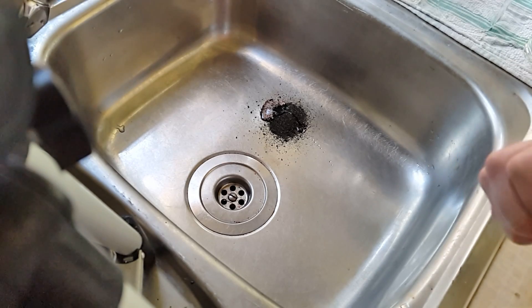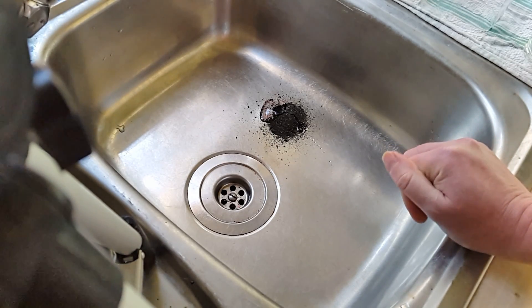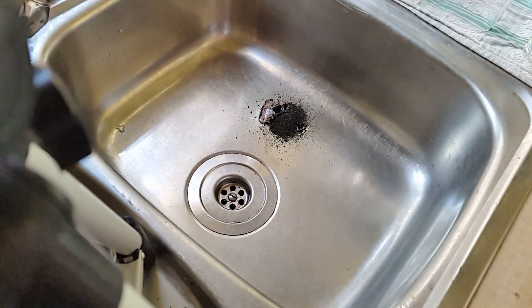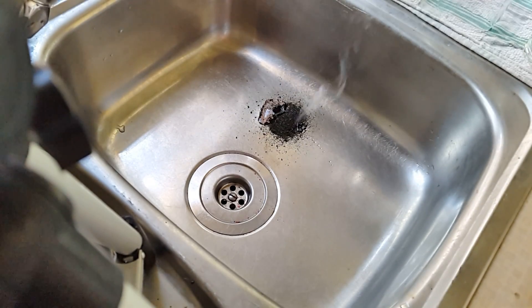My thumbnail looks yellow — it's because I've been smoking really heavily. I've just started. I haven't really — I've had an Indian takeaway. Well, I'm excited. I'm sure you'll agree, fans. Let's just stir things up a little bit. Whoa, didn't have to. There we go.